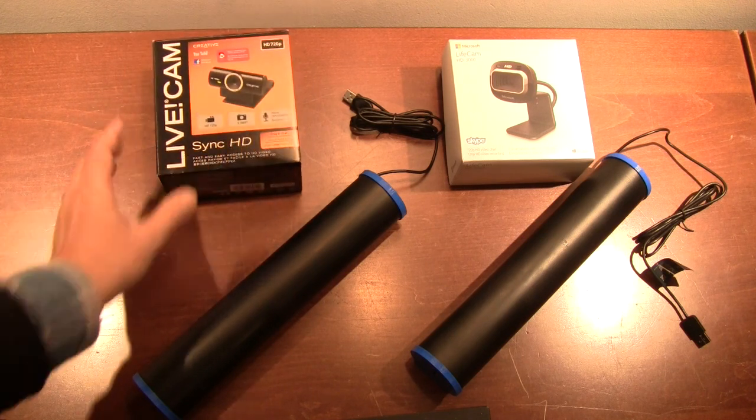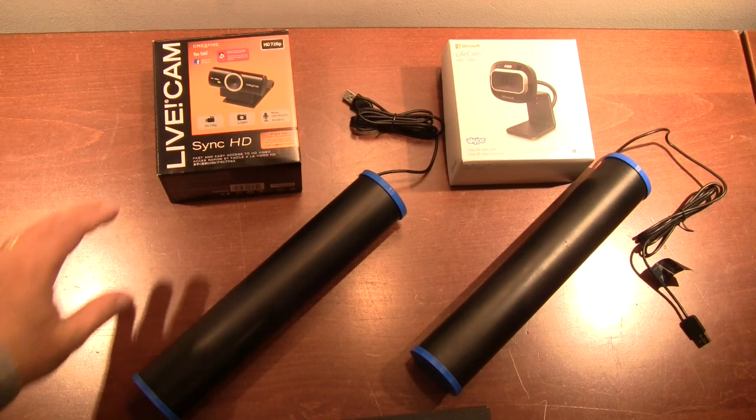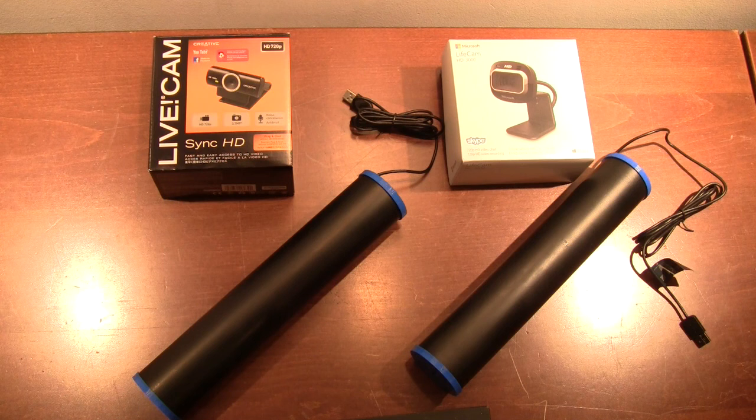webcam. And with this first one, it was very difficult to remove the IR filter, so this ended up being an excellent visible spectrometer and had good resolution, maybe about 1 nanometer between the peaks which could be resolved, and it covered a range of perhaps 360 nanometers to 660 nanometers.